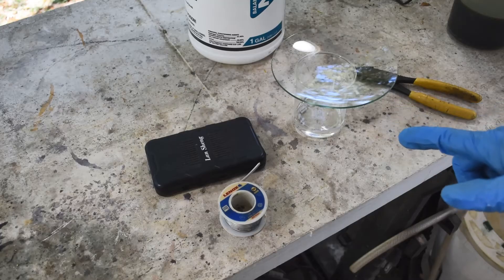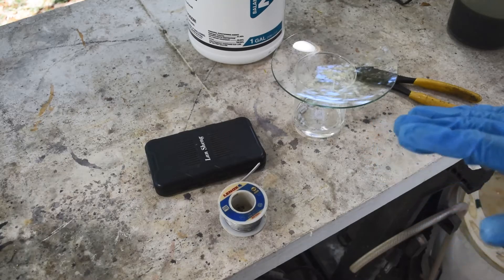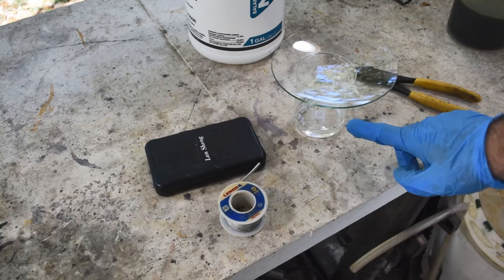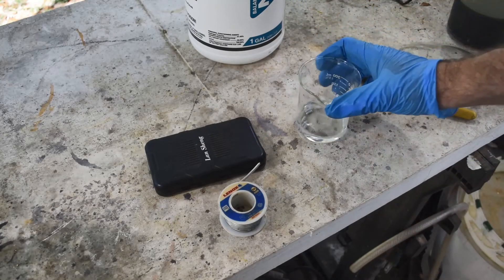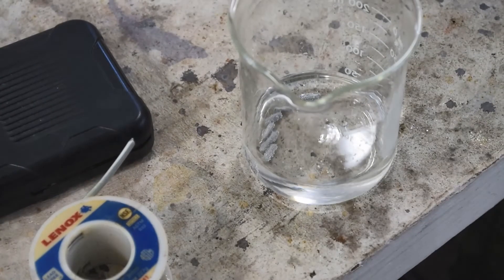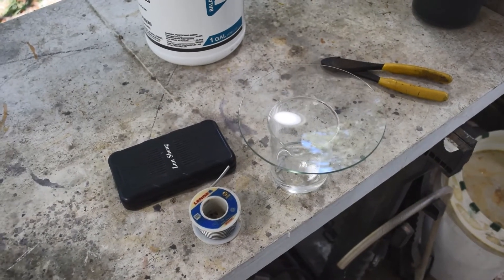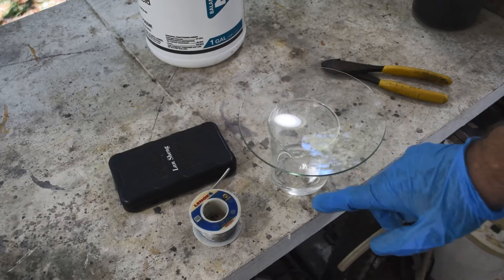The dissolving would happen on its own given enough time, but it's a chilly morning so we're going to give it a little warmth. I'll put this in the fume hood on very, very low heat — the hot plate is barely on. You don't want to boil it or even heat it up too much, but a little warmth will speed up the reaction. The stuff is already bubbling pretty well. Adding warmth helps, especially if you need your stannous chloride solution in a hurry.